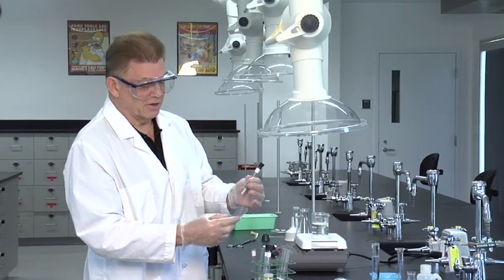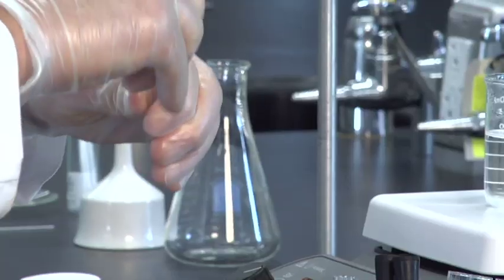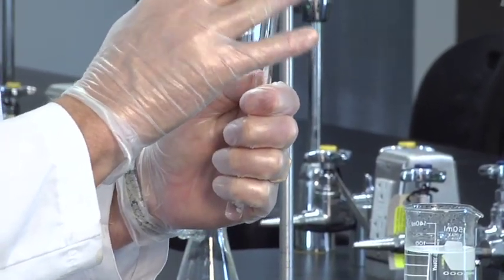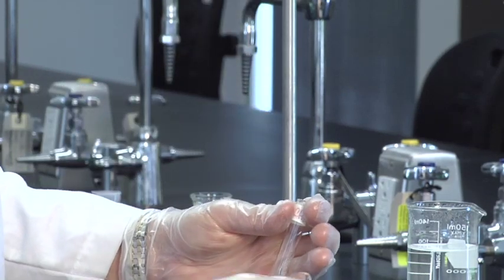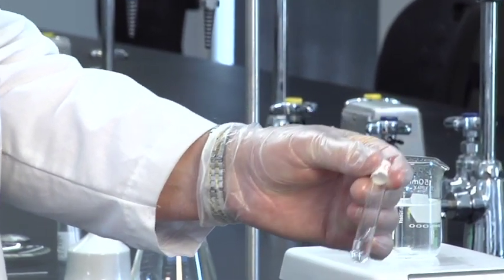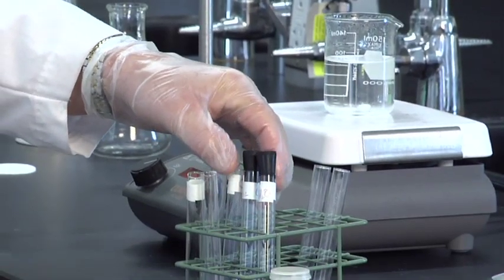Let's try dichloromethane — here's a halogenated solvent. It doesn't look too much like benzoic acid, maybe this will work. Smack it around — that went in right away. There's no solid left. Methylene chloride didn't work either. We're 0 for 2.